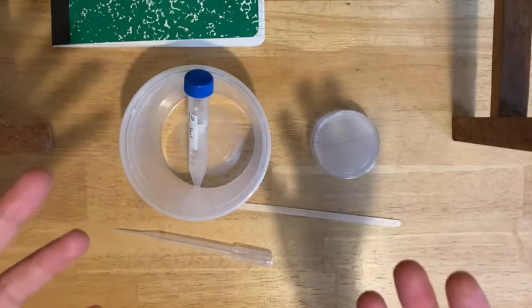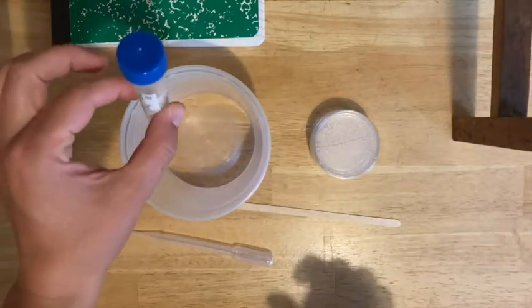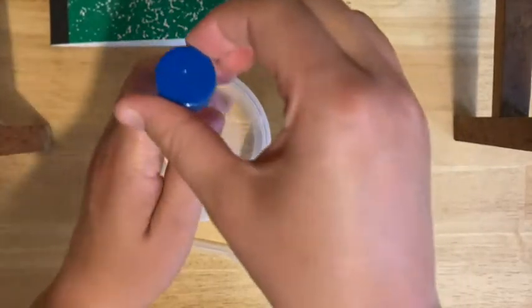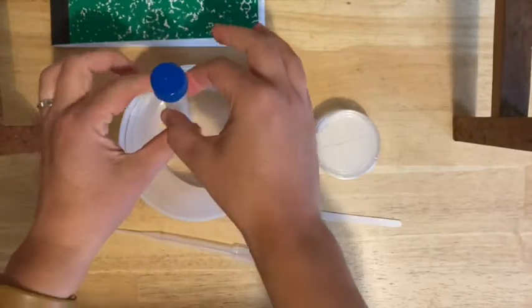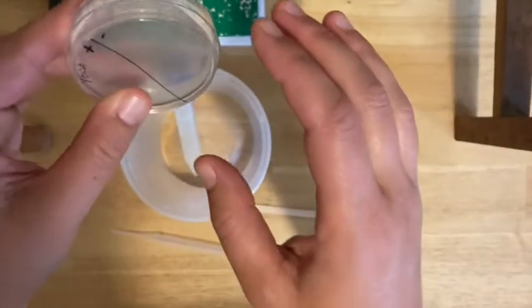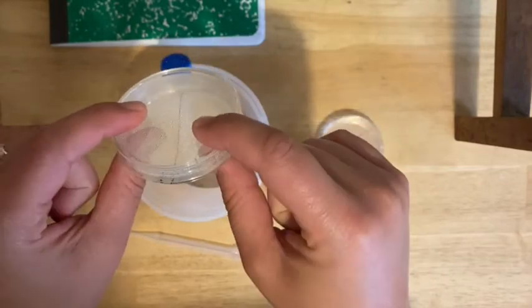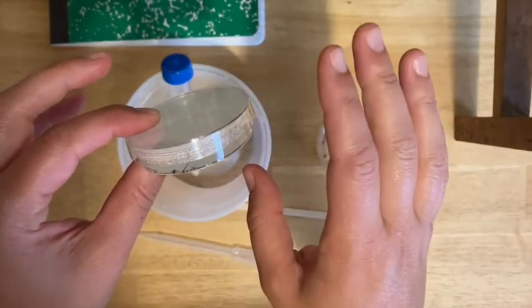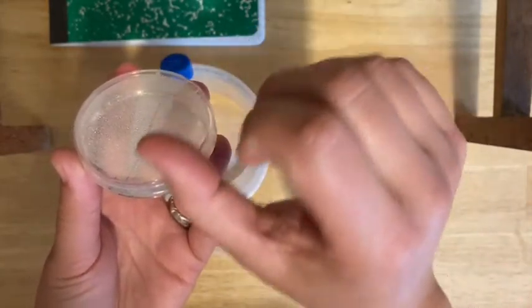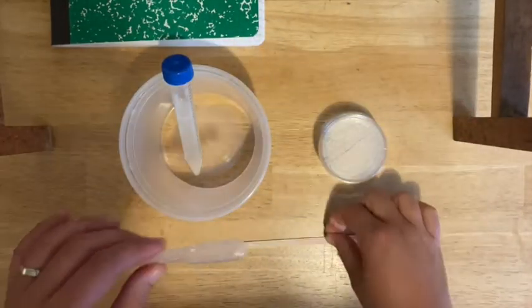Once your plates have cooled, make sure your hands are clean again — wash them well. Put on your mask and safety glasses to make sure you're creating a very sterile environment. We're going to add some of the yeast to the positive side of your petri plates. Screw on the cap tightly and invert the tube a couple of times to mix it. The plates now have a solid layer of agar at the bottom with some condensation on the top — don't worry about that. Make sure these plates stay closed as much as possible, since anytime they're open you risk contaminating. Be especially careful not to touch the inside of the plates — you don't want to like lift the lid with your thumb touching the inside. You're going to need a clean wooden stir stick and a clean transfer pipette.